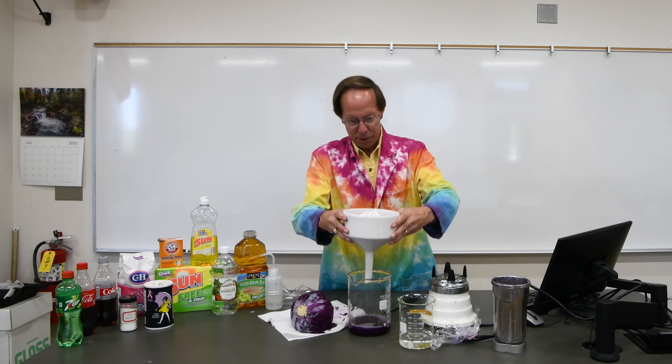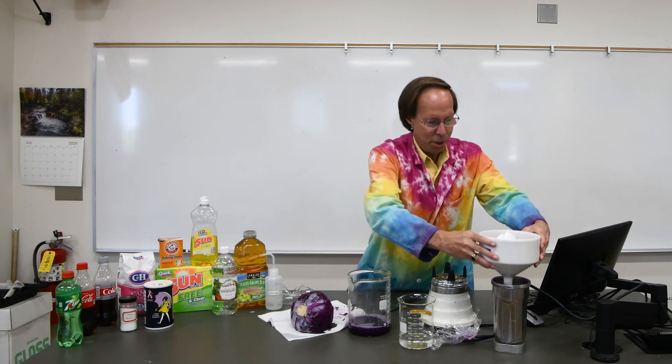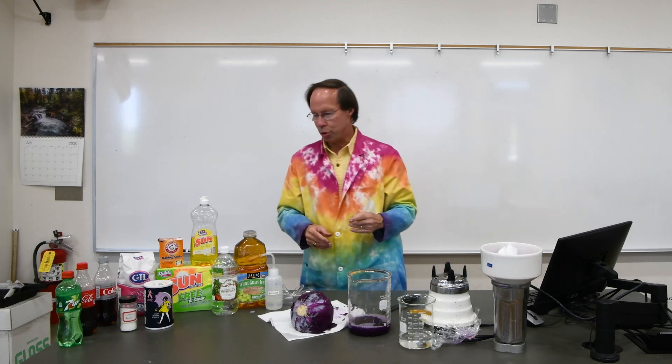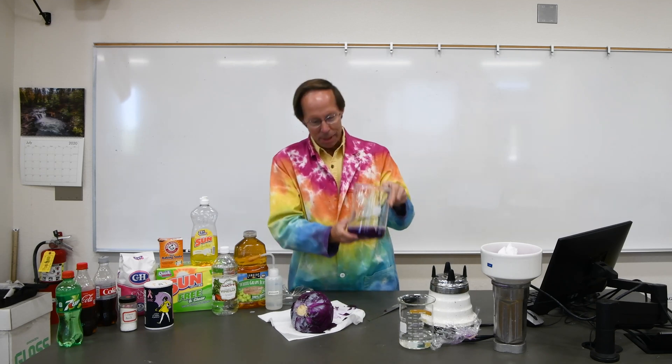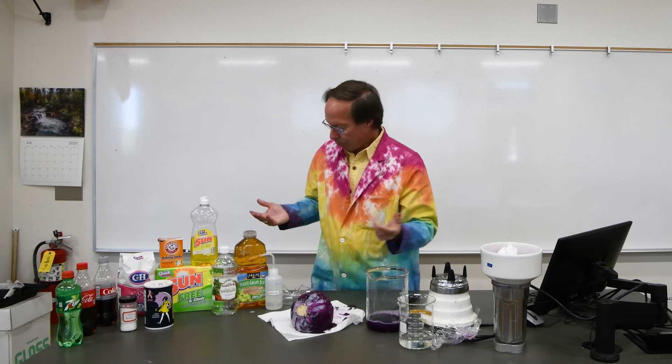So we'll take our funnel, set it over here, and now we have our cabbage juice. So we can use this cabbage juice to test the pH of different materials.